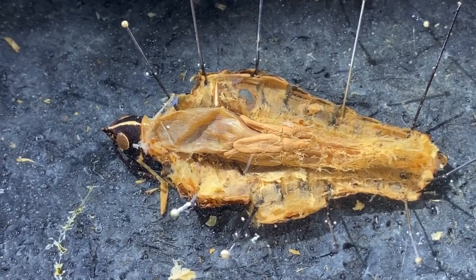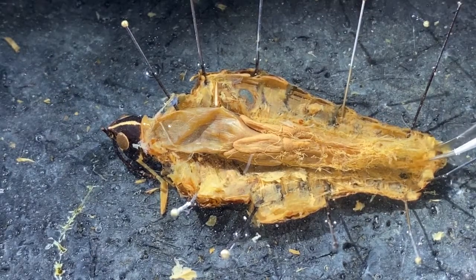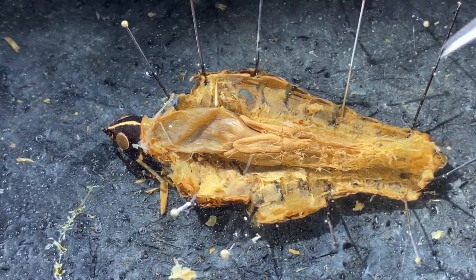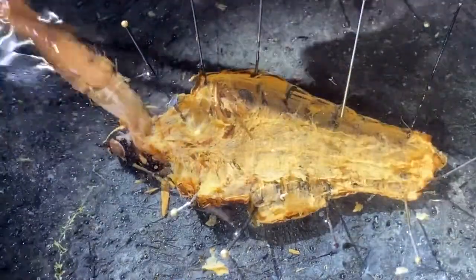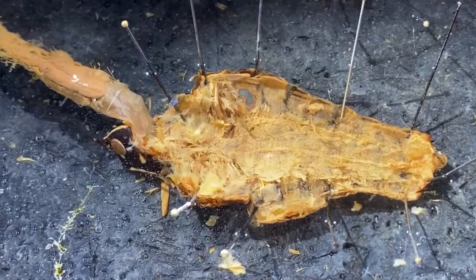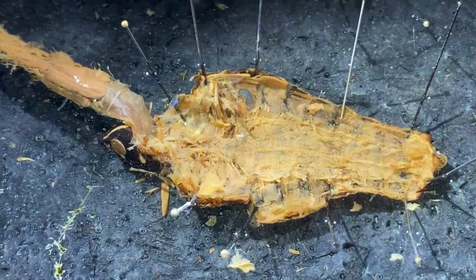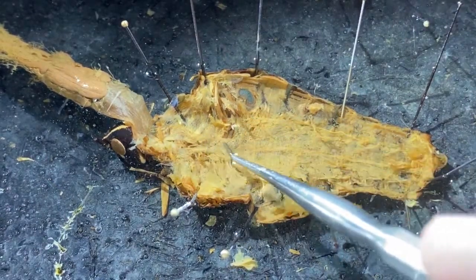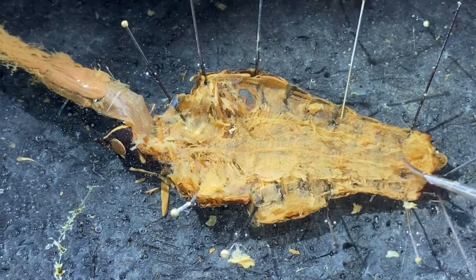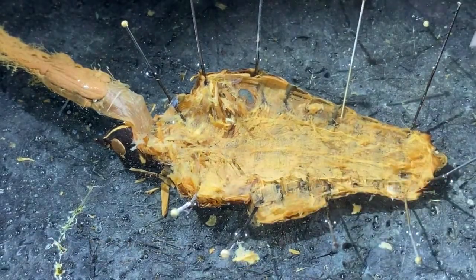All right, so what I've done now is I have detached the posterior end of the digestive tract from the body wall so that we can pull it forward and out of the way. Now you can see underneath it, down along the ventral wall of the body, this whitish line right here that runs the length of the body. This is the ventral nerve cord of this animal.